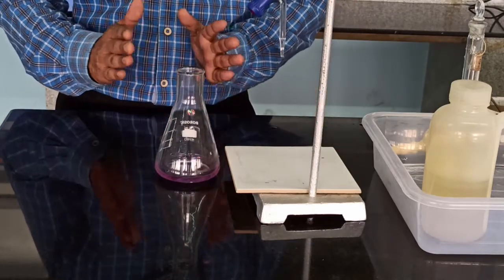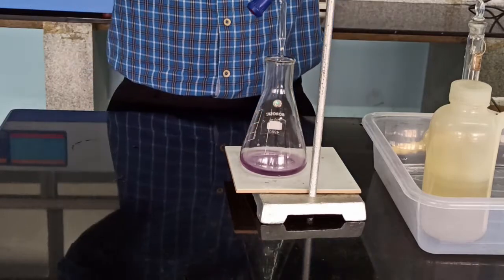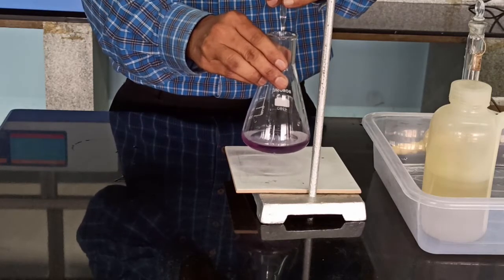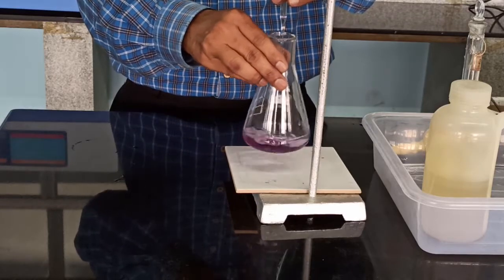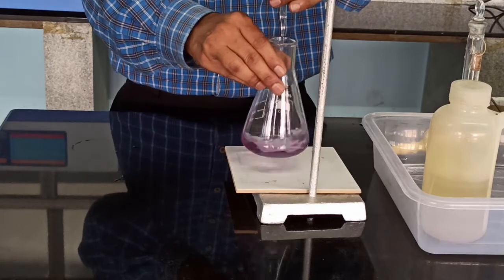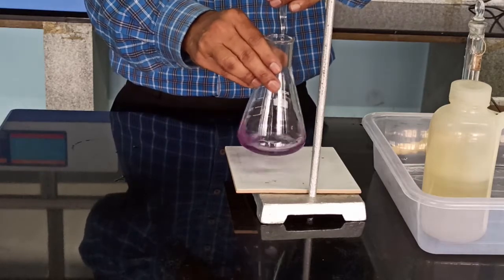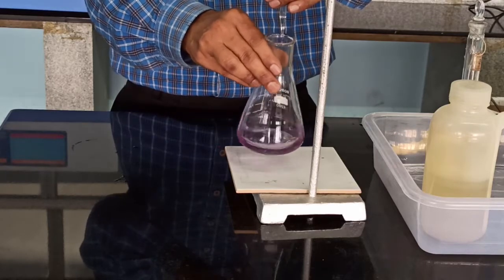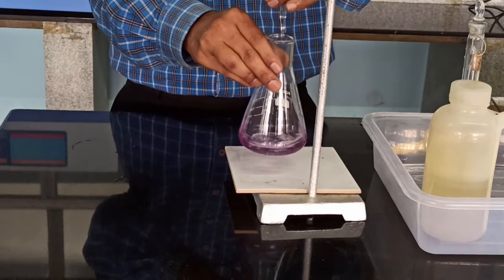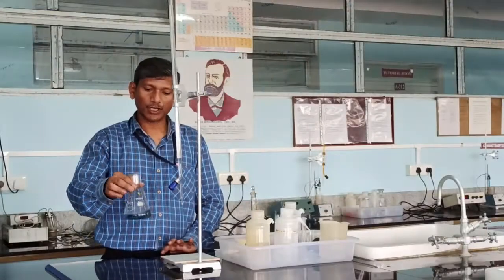The calcium–EBT and magnesium–EBT complexes give a wine red color. Titrate this wine red color solution against the EDTA solution taken in the burette until the wine red color changes to a clear blue color. First, EDTA combines with the free calcium and magnesium ions and forms a stable complex. Then it reacts with the unstable calcium–magnesium EBT complex, forming stable calcium–EDTA and magnesium–EDTA complexes. The free indicator then gives a clear blue color at pH 10.